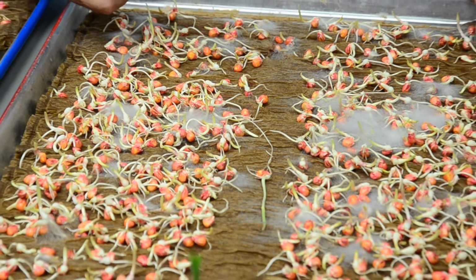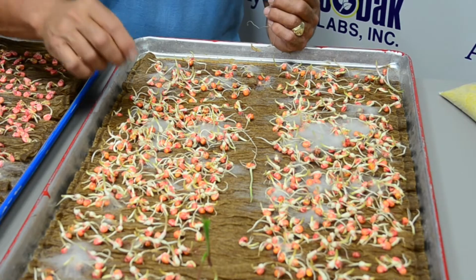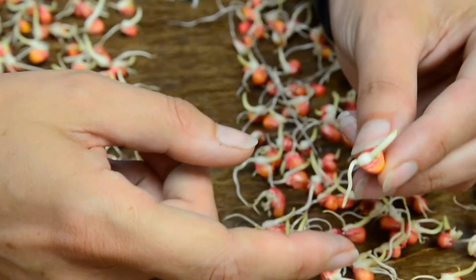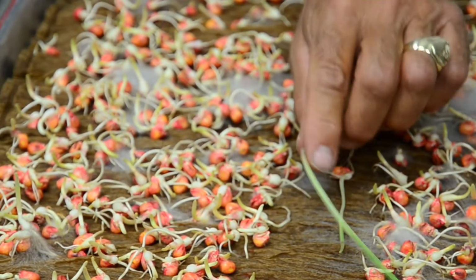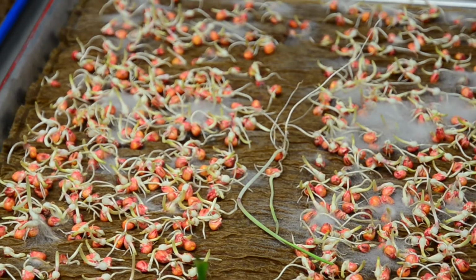3 tall seedlings. They have well-developed root tissue, normal developing mesocotyl and coleoptile, and the rest of all of these are stunted. They don't have secondary roots. The coleoptile and the plumule are all stunted. So this gives a very accurate percentage for glyphosate tolerance here. You have 3 out of 1,200.